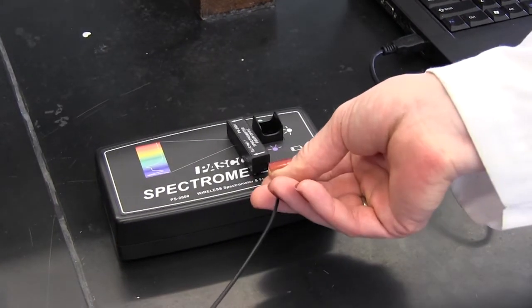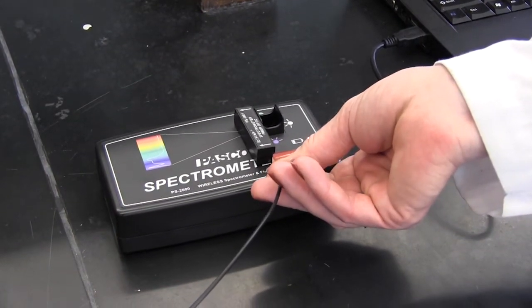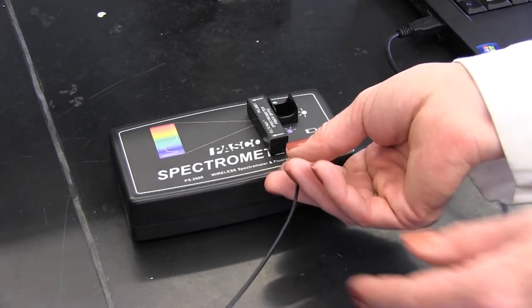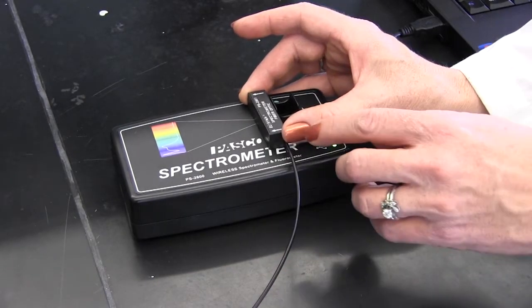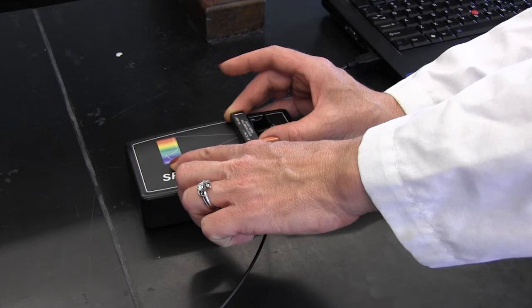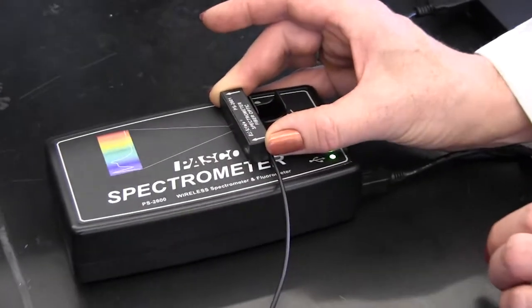Here is your fiber optic probe. This is the end of the probe that goes into the spectrometer opening and you'll see that there are arrows on the probe and the arrows have to point towards the rainbow on the spectrometer face to be oriented in the correct direction.